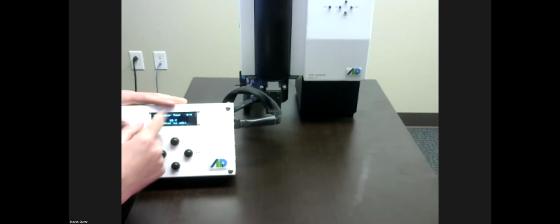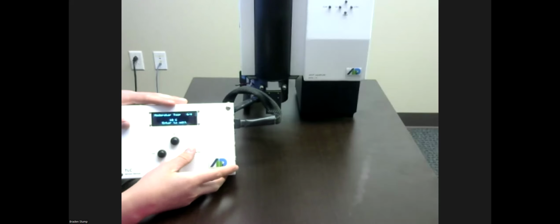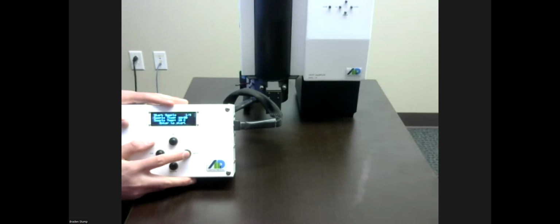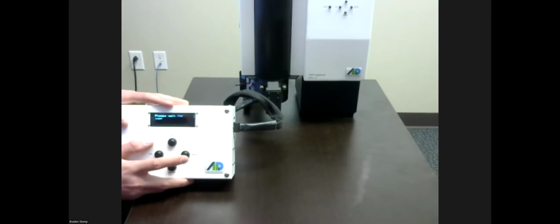If you know a good starting moderator temperature that keeps you from fluctuating too much as a good base state, this is a good time to enter that. So we'll go back down though and go ahead and hit enter to start our sample. We have a liquid vial loaded, we're down to temp, and we're ready to go.